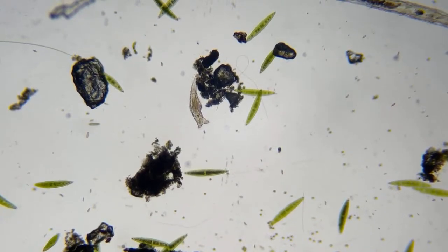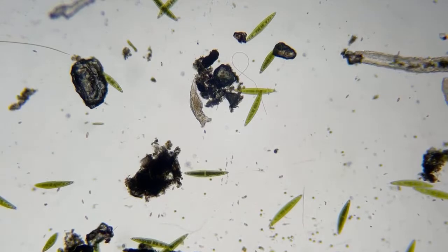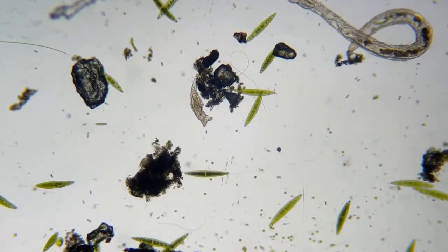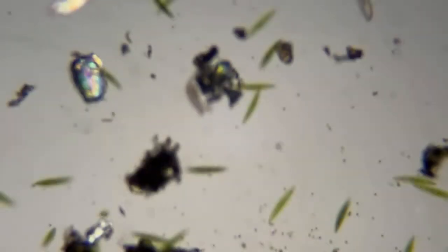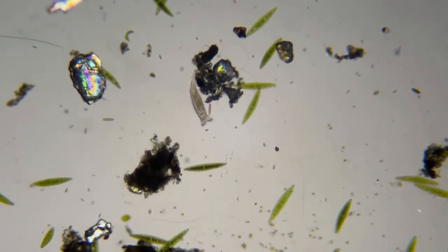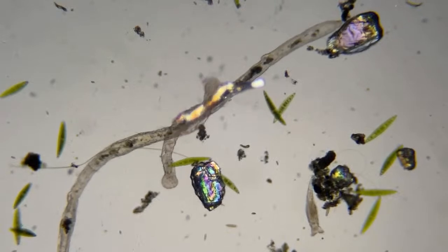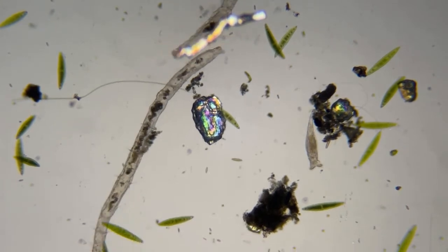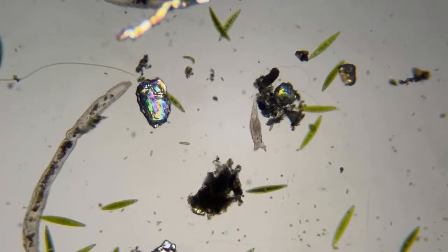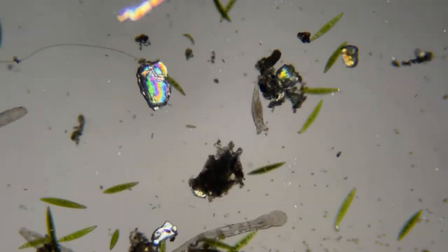And I'm gonna polarize this for a minute and see what we can see with polarized light. Some things are really, really good in polarized light, and some are not. So let's see what this rotifer does in polarized light. So you can see just by putting the polarizer on it, see how the minerals, anything shiny you see right there is either a starch or a mineral, okay? Whenever you see something shiny like that. So sometimes these creatures have minerals inside of them. I don't see any in this guy, so let me darken it a little bit.